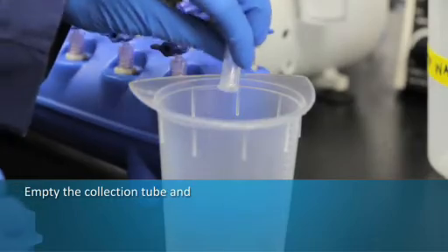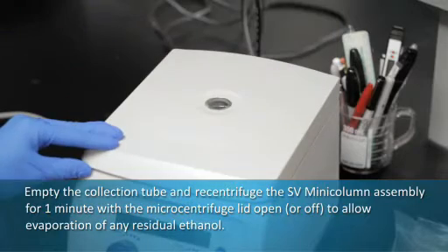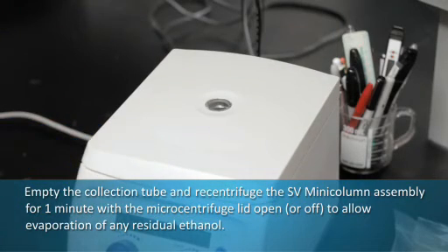Empty the collection tube and recentrifuge the column assembly for 1 minute with the microcentrifuge lid open to allow evaporation of any residual ethanol.